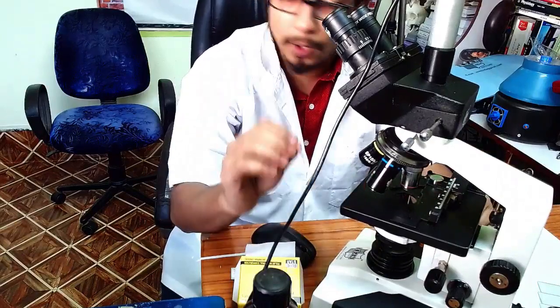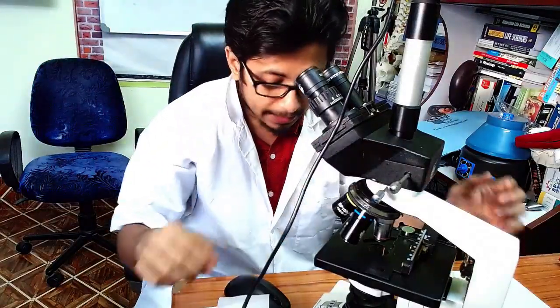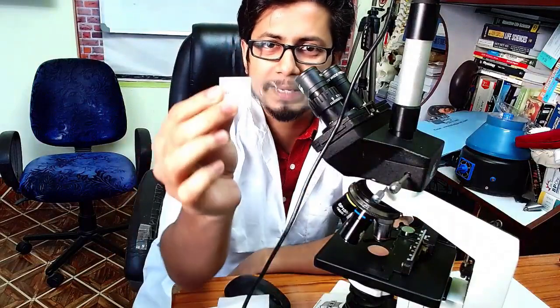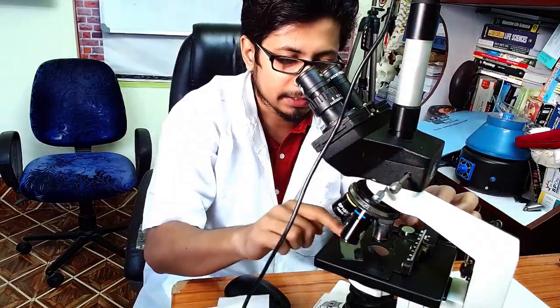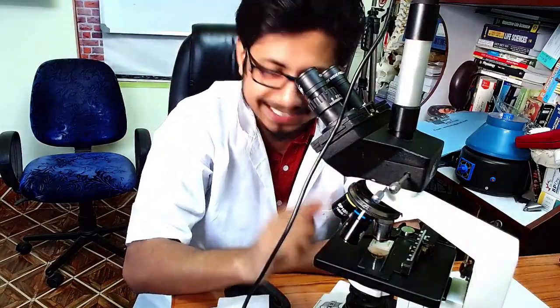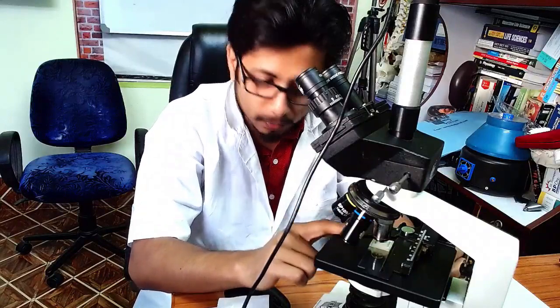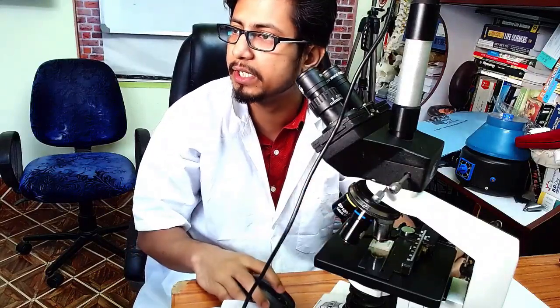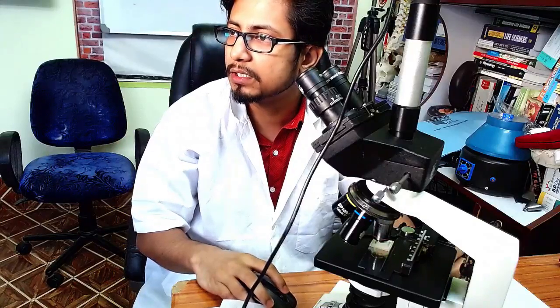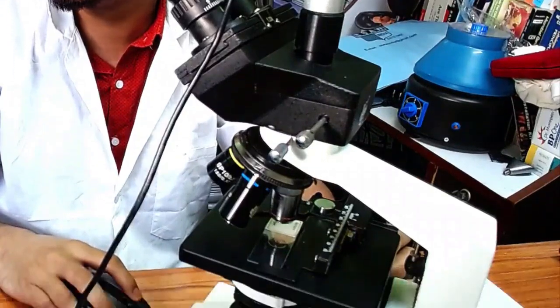The biggest mistake people make about focusing a microscope starts here. Let's say this is an algae slide — I'm going to put the slide in like this. The first step is putting the slide onto the stage. Step number two is adjusting the specimen according to the objective lens where you want to focus. If you zoom into the image, you can see the sample and the 40x lens.